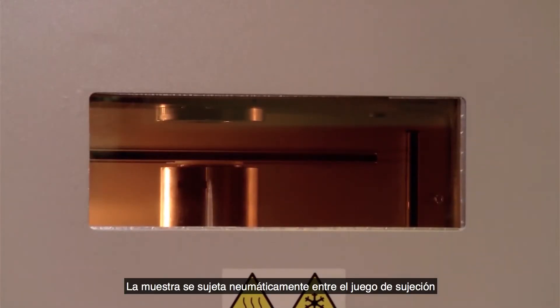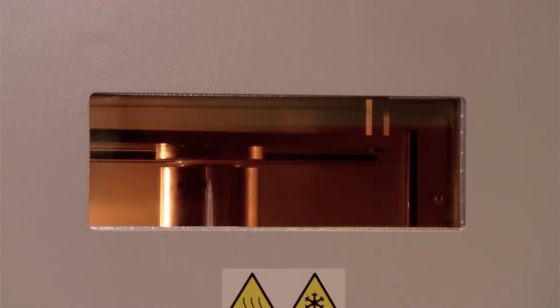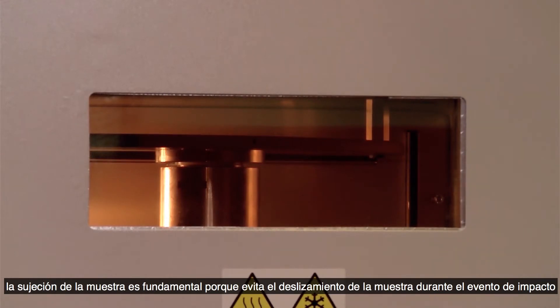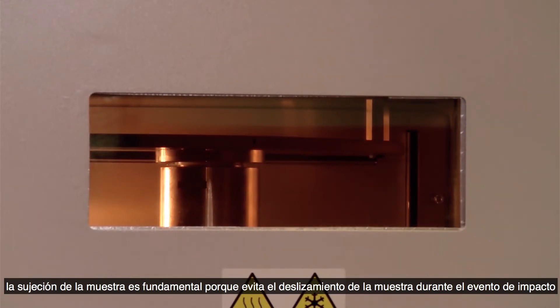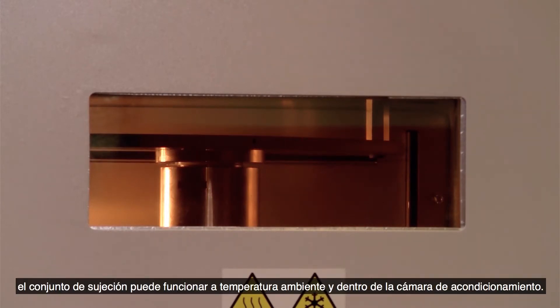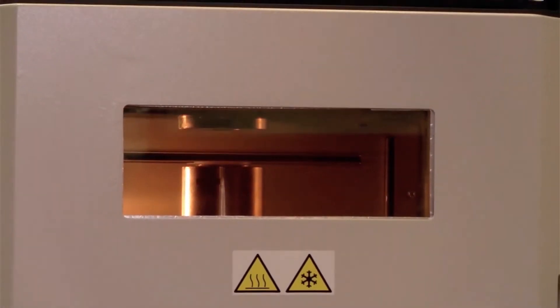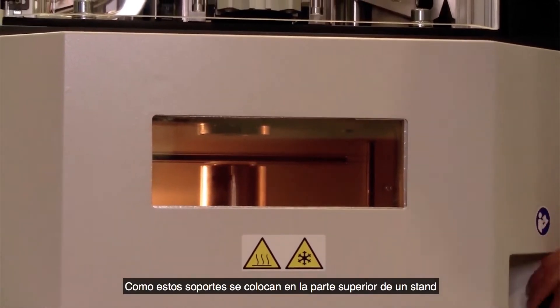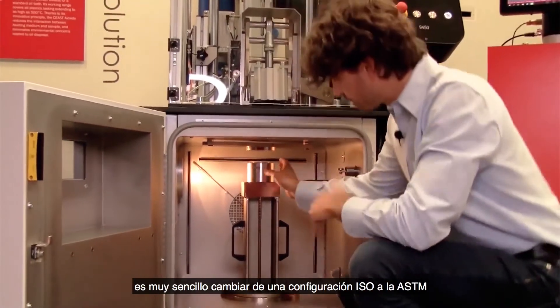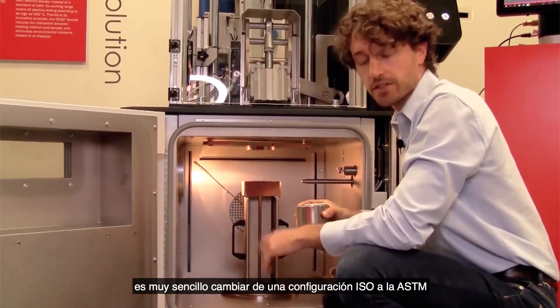The specimen is pneumatically clamped between the clamping set. Specimen clamping is critical because it prevents specimen slippage during the impact event. The clamping set can work at room temperature and inside the conditioning chamber. As these supports are positioned on top of a stand, it's very simple to switch from an ISO configuration to the ASTM one.